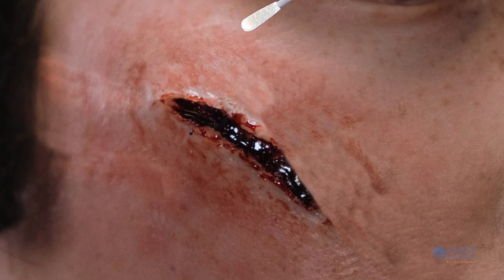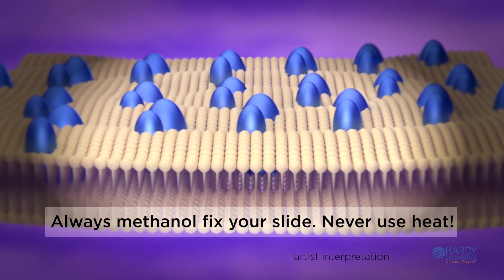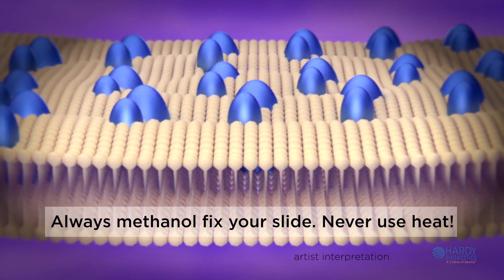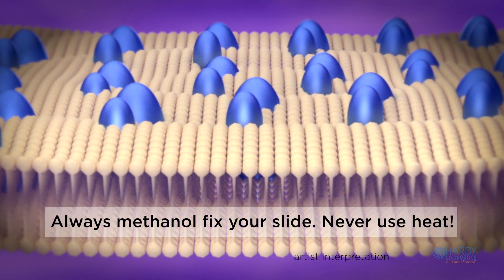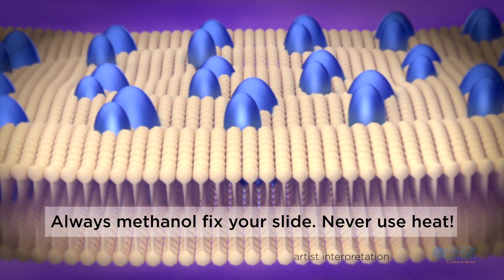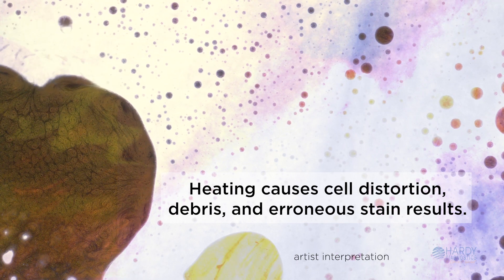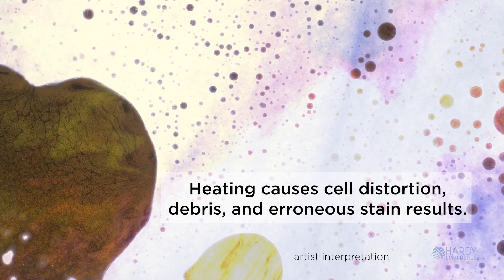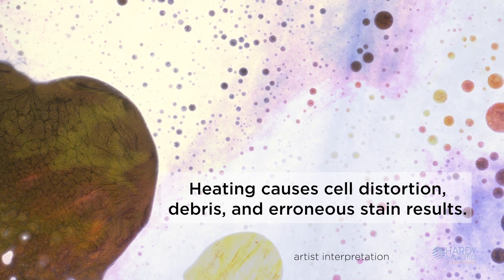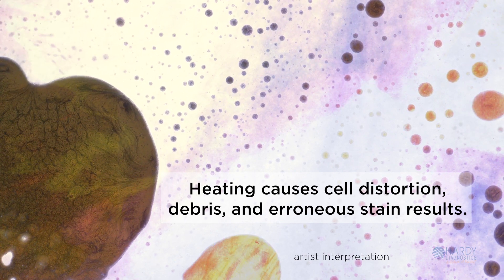Do not heat the slide. Wait for the sample to air dry. Bacterial cells are then fixed to the slide using methanol. Fixing cells is important, as it prevents the cells from washing off during the staining process. Methanol fixation is recommended rather than heat fixation, as methanol preserves the cell's morphology. Heating the slide will cause cell distortion, could increase cell debris, and may cause erroneous gram reactions.